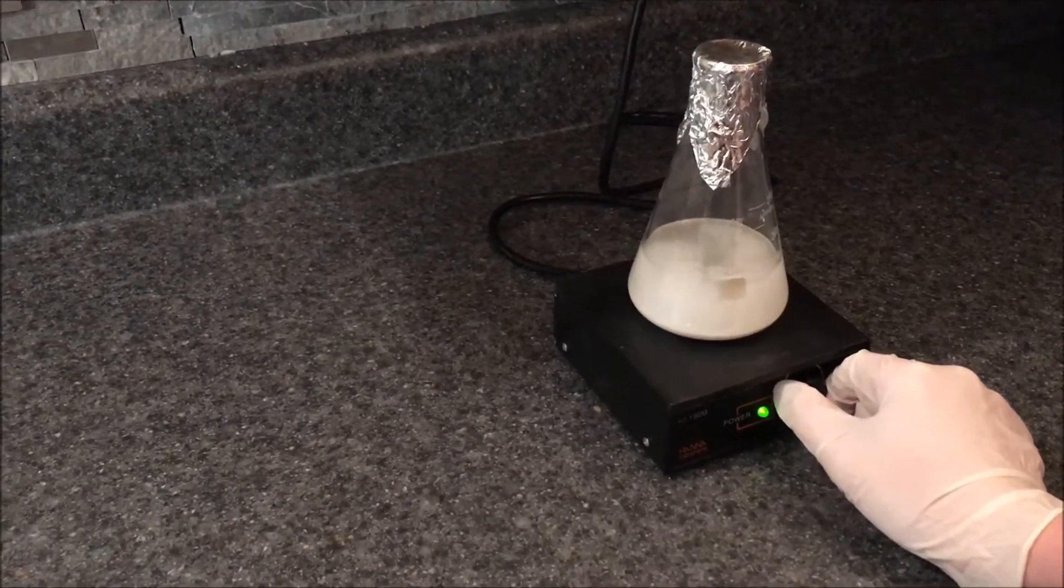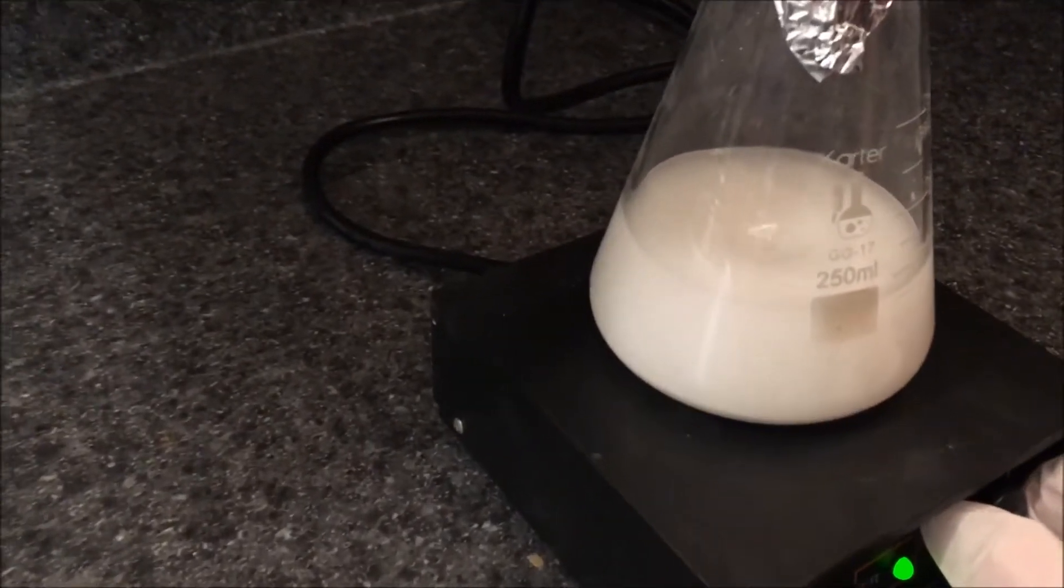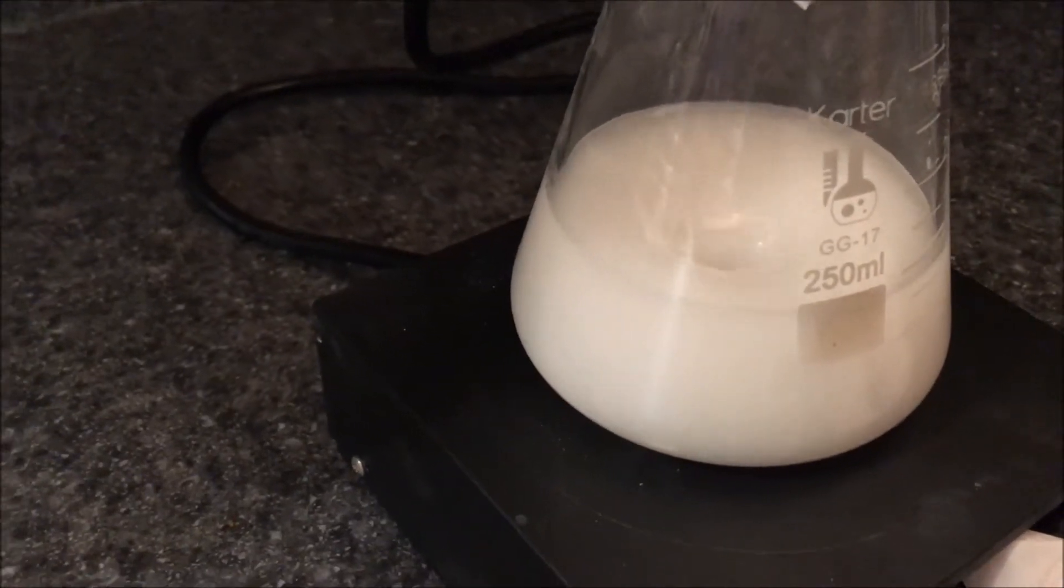Next, you will want to stir it for about an hour. I place a cover over my flask to limit the solvent loss.